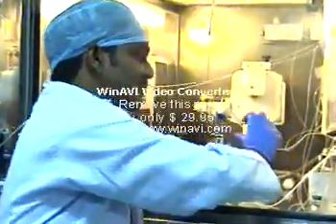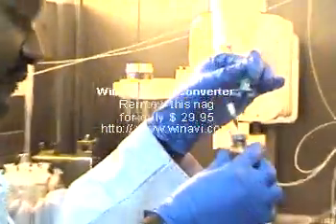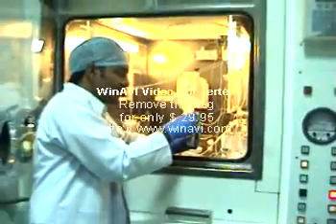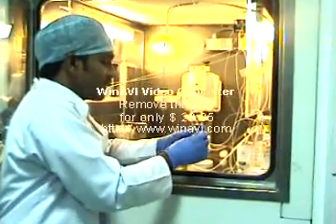The line you are seeing is called the delivery line. Once the FDG is produced, it reaches the sterile vial through this delivery line. At the end of the delivery line you can see a filter — this is called a GS filter; it is a 0.22 micrometer filter. In case any particles escaped from the purification step, they will be trapped here, and we will get very high purity fluorodeoxyglucose.